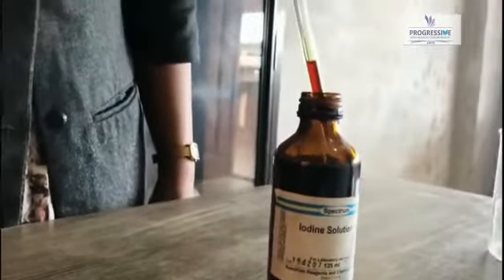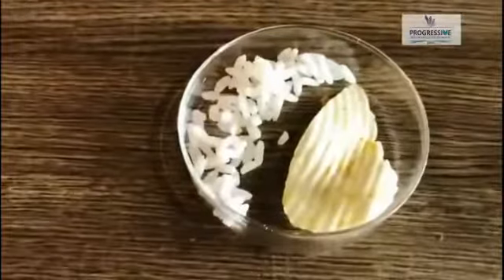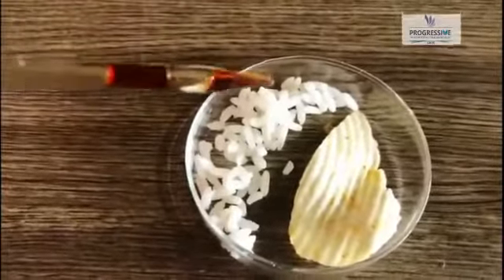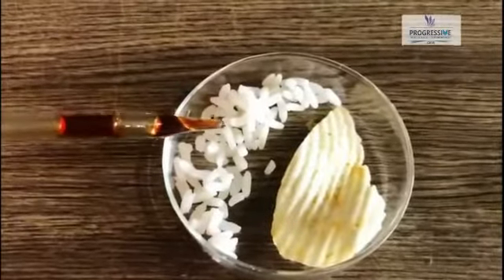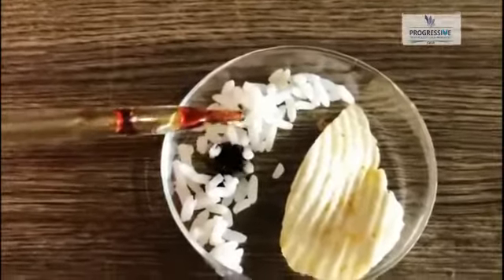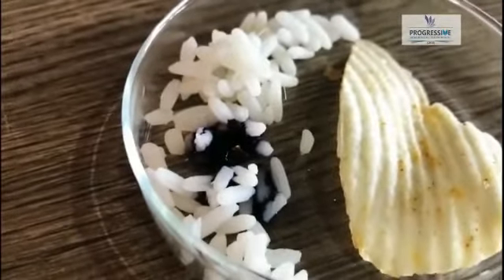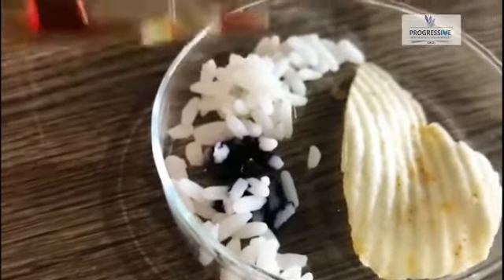Now we are going to test on the rice and the potato chips. We have some rice here and potato chips. Now I am adding two drops of this iodine solution on the rice. So what can you observe? What is the color here? We can see a blue-black color. So we can confirm that starch is present in the rice.